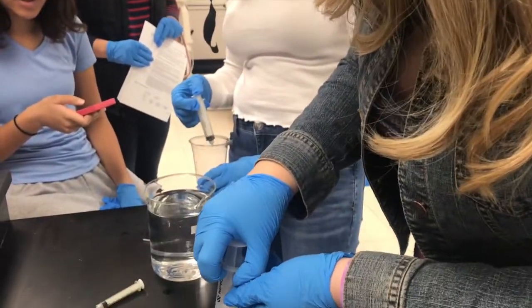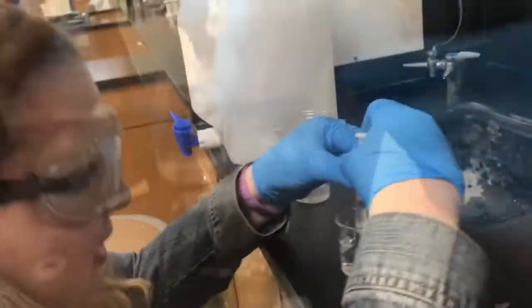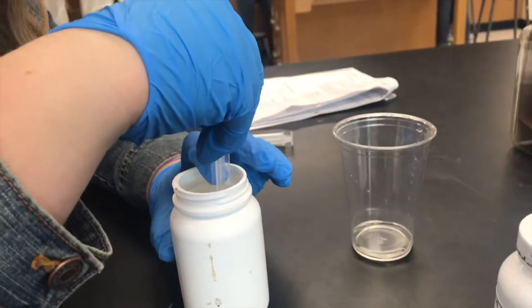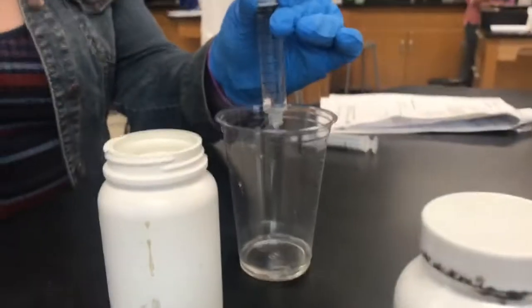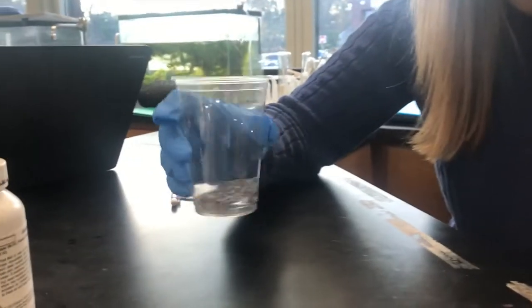For Part B of our lab, we placed 10 milliliters of 1.5% H2O2 into a clean glass beaker. We then added 1 milliliter of H2O into our H2O2 solution. Then we added 10 milliliters of H2SO4 using extreme care. It's important to use extreme care in handling acid. Your teachers should instruct you on the proper safety procedures for handling such hazardous materials. We mixed the solution together well.